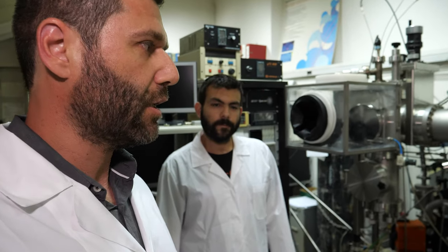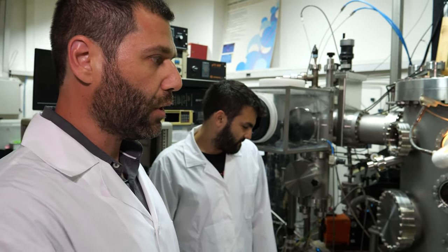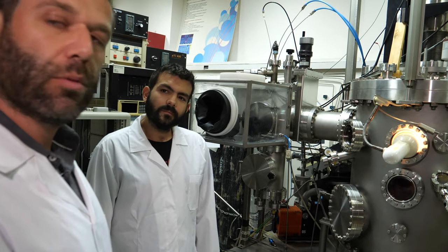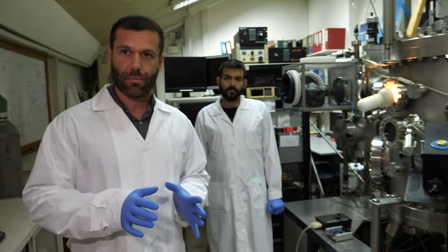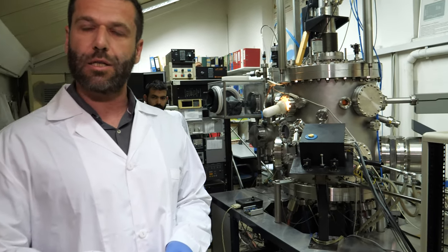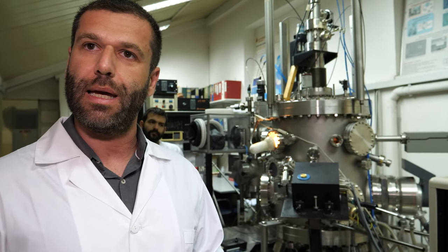The really cool thing about this technology is that it's not only one of the few around the world, but we also combine it with real-time metrology. We can measure at the same time that material is deposited onto a substrate — we can measure the changes of the properties of the film that is created. This is something very unique.